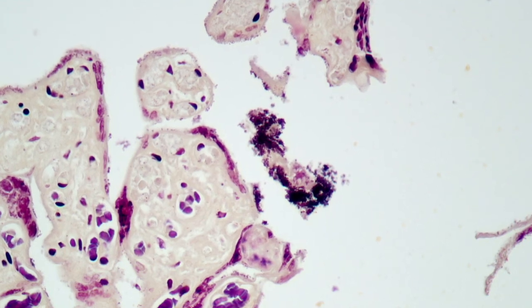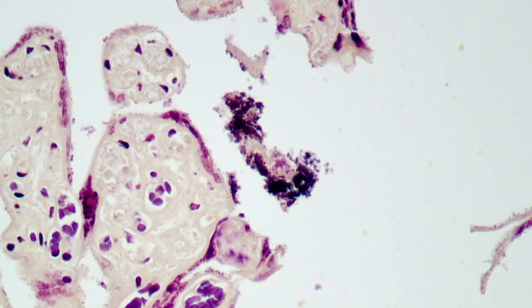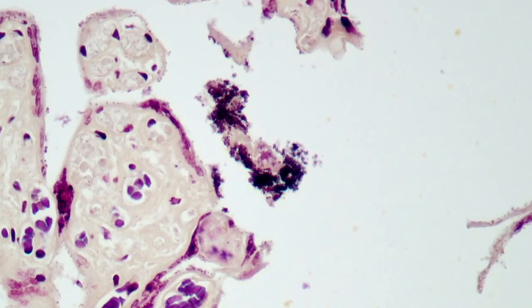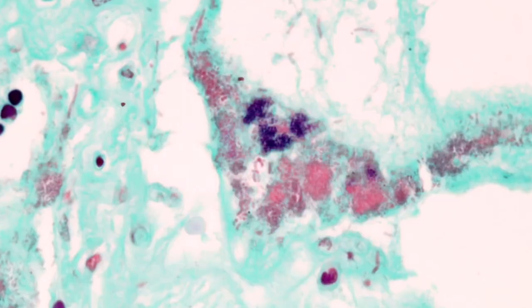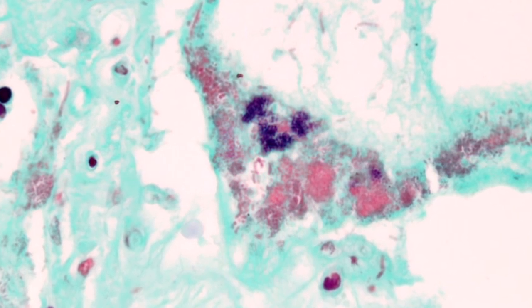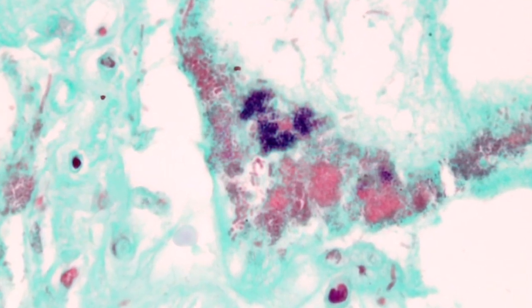So there we have it — two different variations of the Gram stain using different counterstains. The question arises as to which technique is best. There's really no simple answer; it may come down to personal preference. In my case, I think I prefer the Twort method, simply because there are fewer steps to employ — it's quite nice just putting on one counterstain solution. But in practice, the best method is the one that you have optimised in your laboratory using control sections.